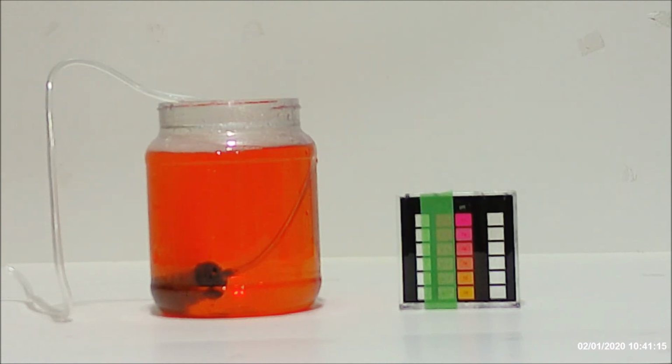So as you can see at this point, we're pretty much back to where we were before. We have our really super duper high pH now. The water is evenly mixed around. And the only thing that's going to happen is it's going to get so high that the pH is not going to register on our color comparator.